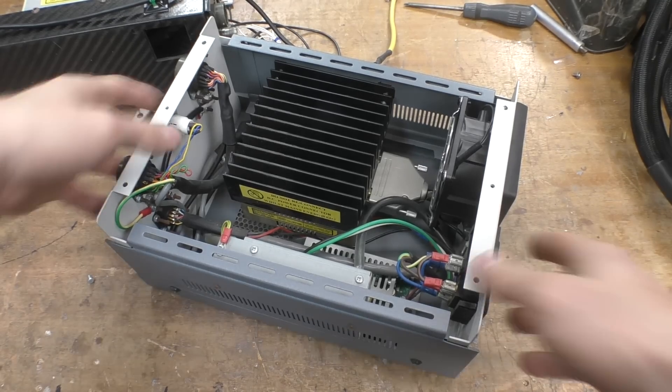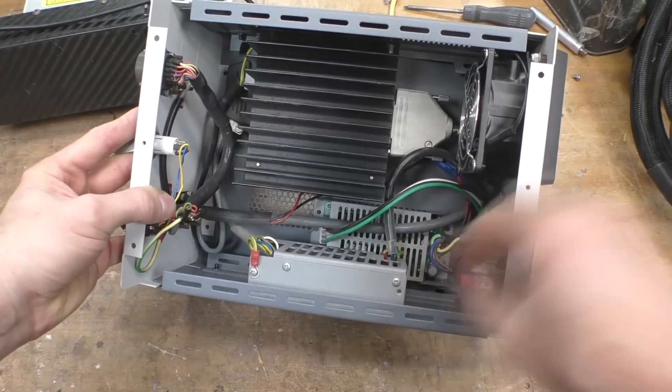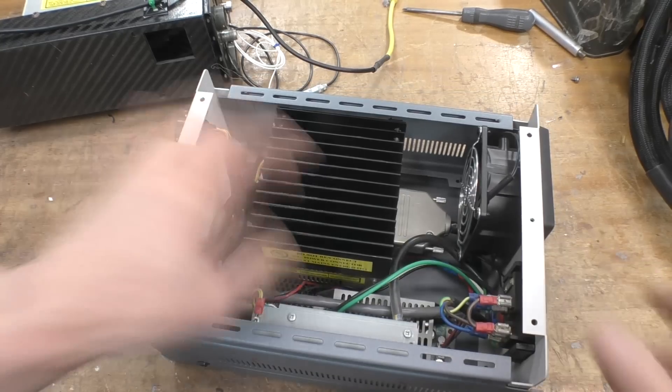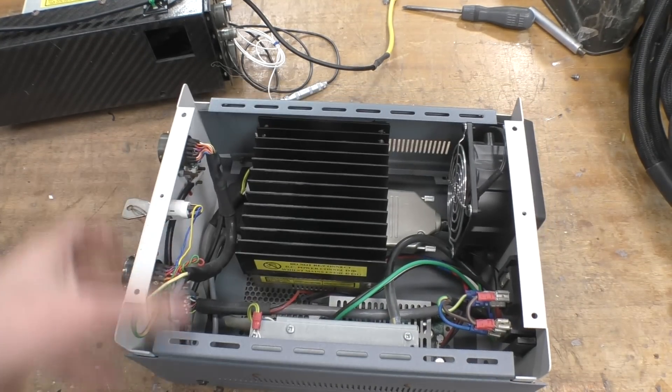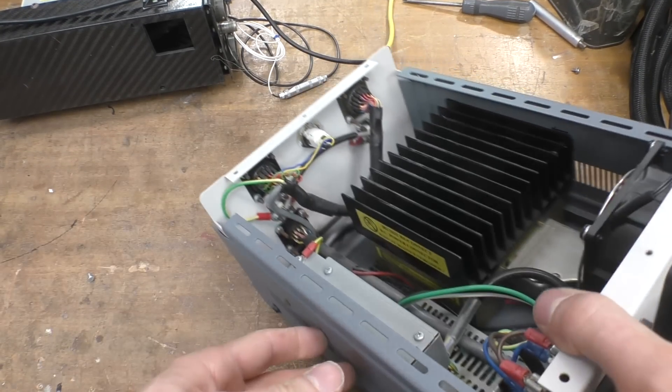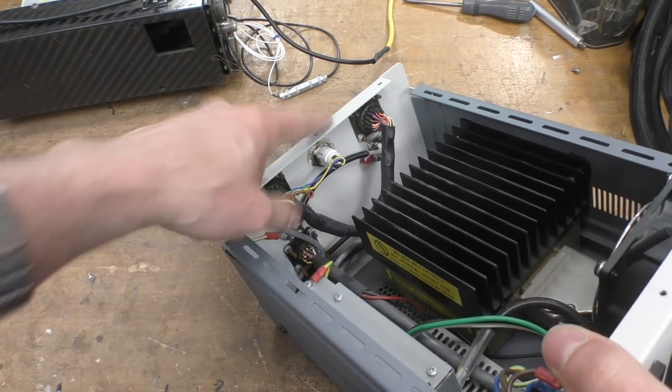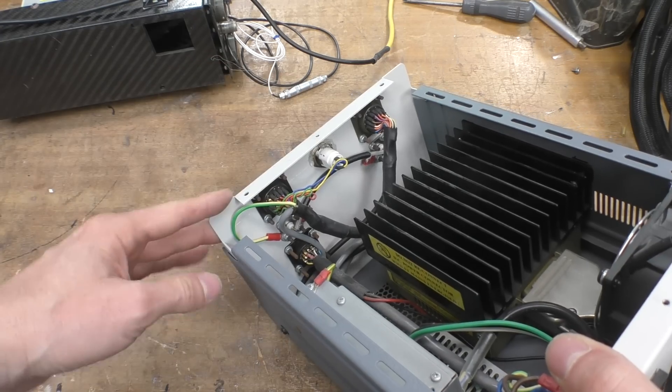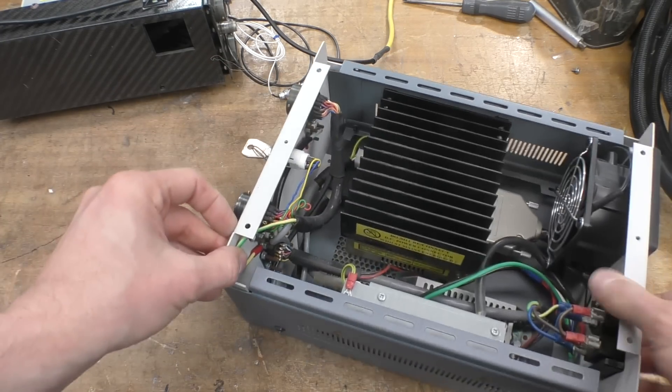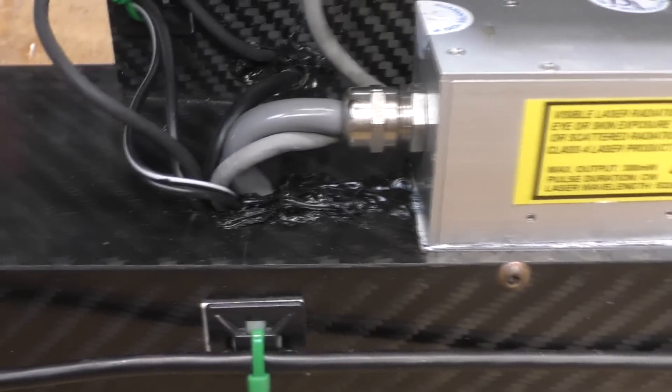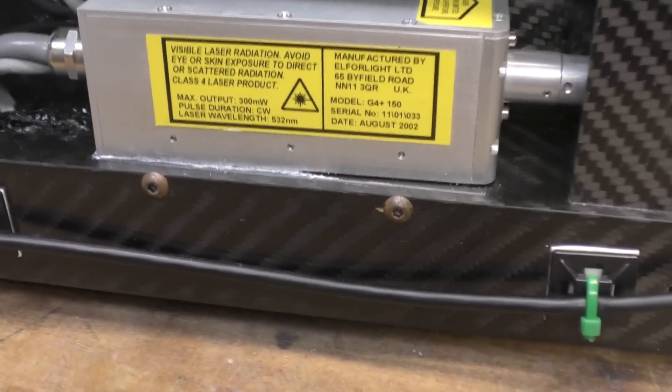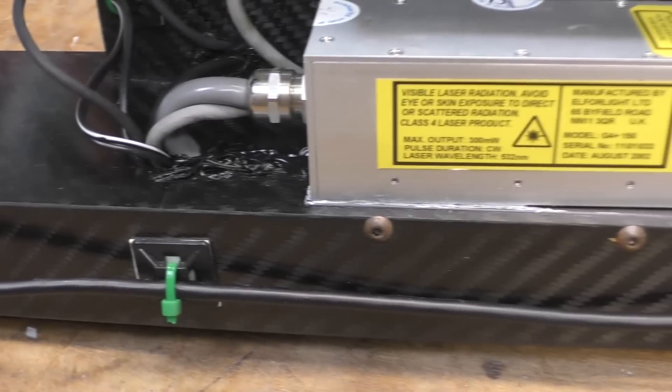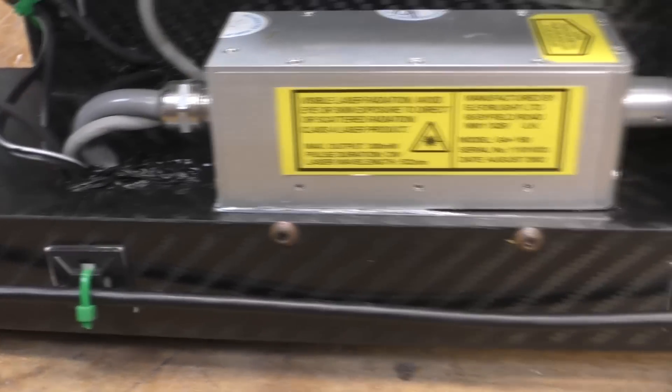Inside the box is pretty much what we expected - a couple of mains power supplies and the driver for the laser, and just some interconnect between the head connector and that multi-pin connector for the PC. The construction is quite annoying because all the wires have been threaded through holes and terminated at each end, so it's really hard to just get stuff out. I think I'm just going to try and separate out the laser connections into the controller and get that fired up.